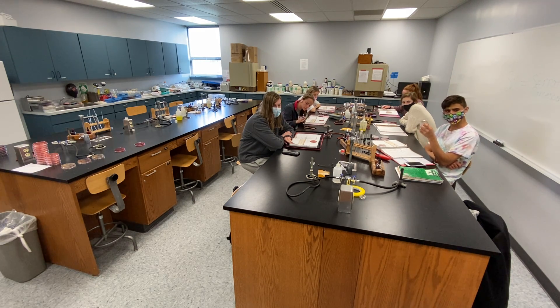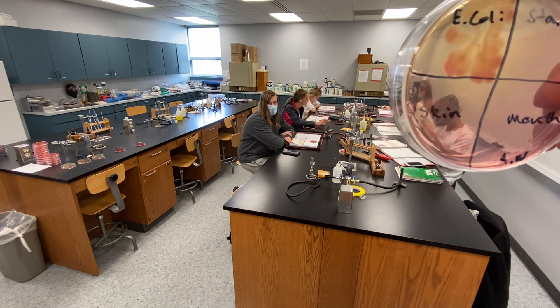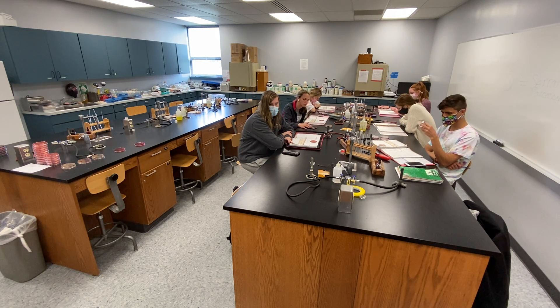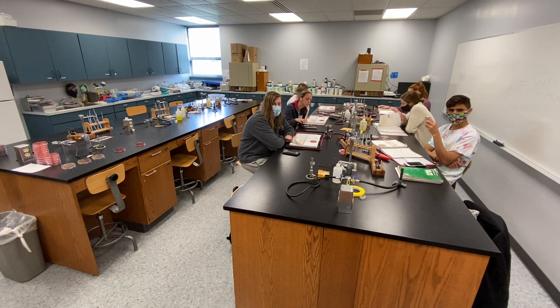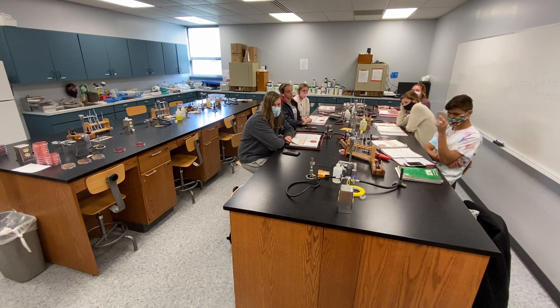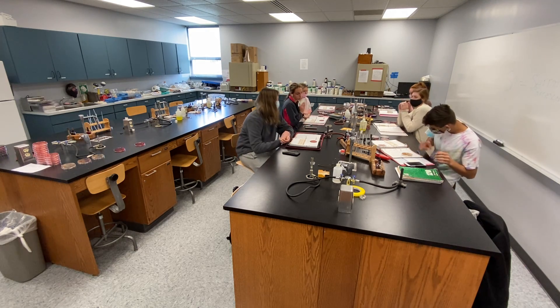How about your skin and mouth microbiota? All types have trouble growing on MacConkey — you can barely see very poor growth. Why do microbes from your skin, fingers, and mouth have trouble growing? Because on the skin and in the oral cavity, gram-positive bacteria are more abundant. Very good — nice job.